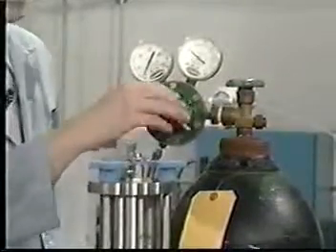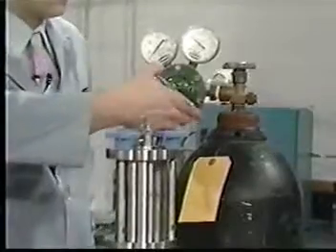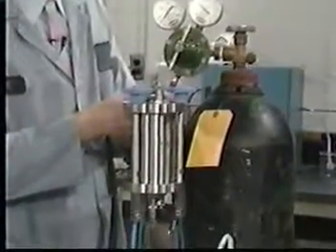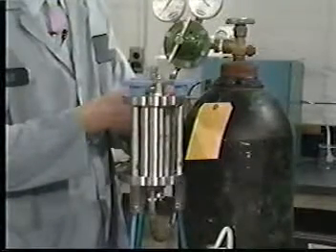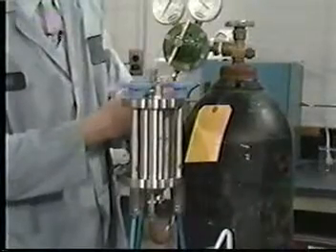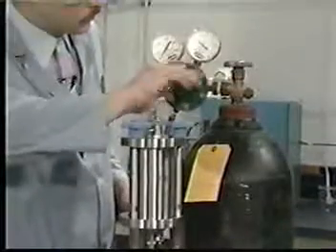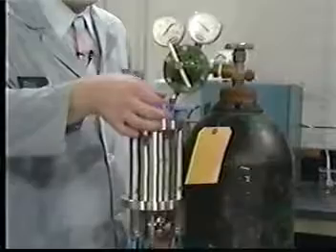With the liquid inlet-outlet valve again on top, slowly apply 5 to 10 psi behind the piston and carefully open the liquid inlet-outlet valve under a hood. This will bleed any headspace left in the device. Quickly close the valve at the first appearance of any liquid. Repressurize the ZHE with 5 to 10 psi and check all fittings to ensure that they are closed.